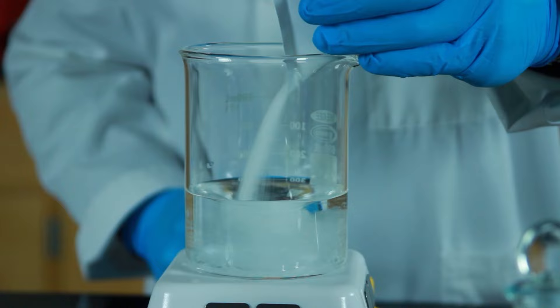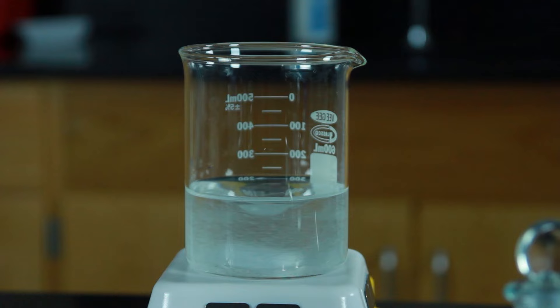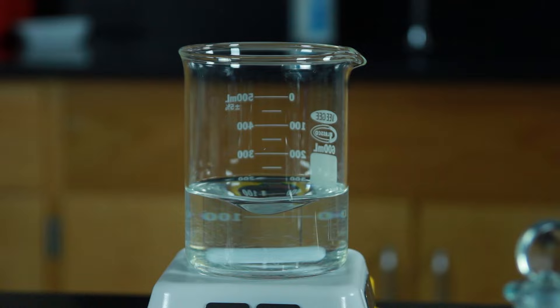Next we need to add the powder to our 600 milliliter beaker. Flick the weigh boat with your finger to add any remaining powder. Mix the solution until it looks completely clear. There should be no visible clumps of powder in the beaker.